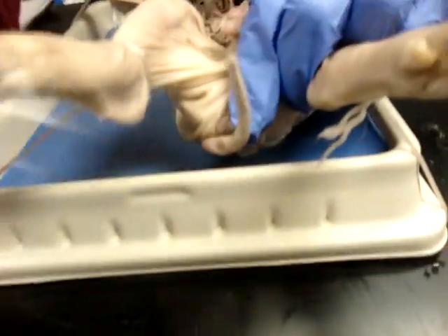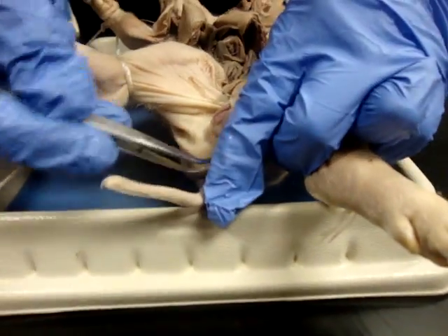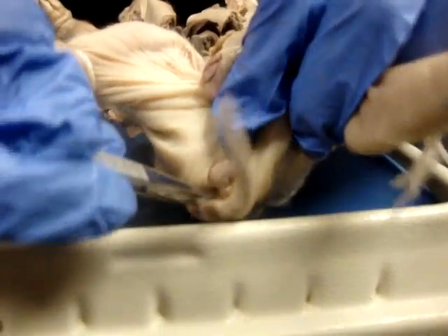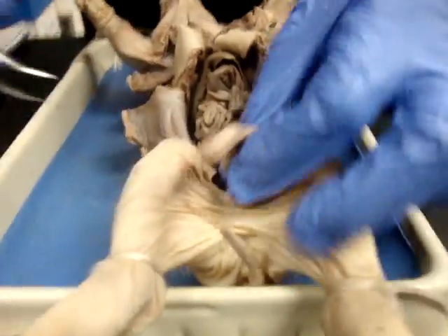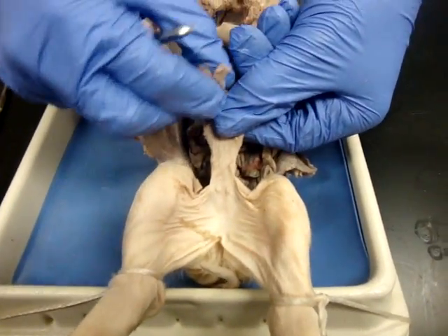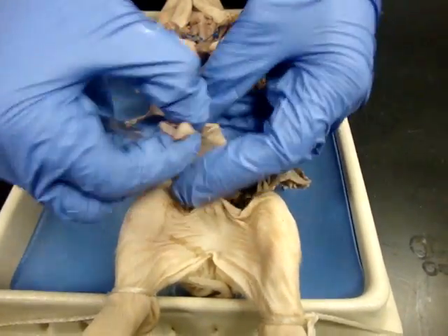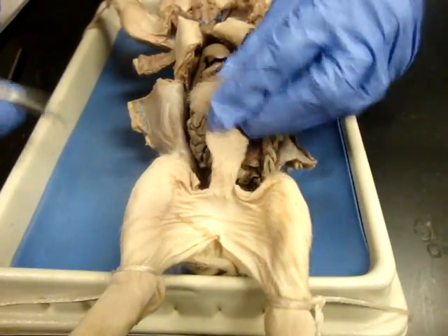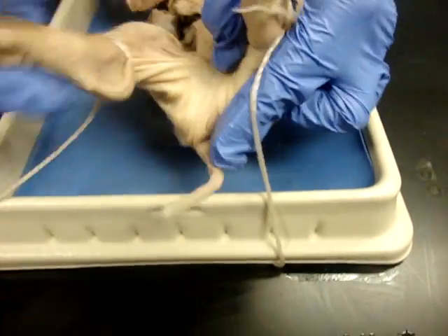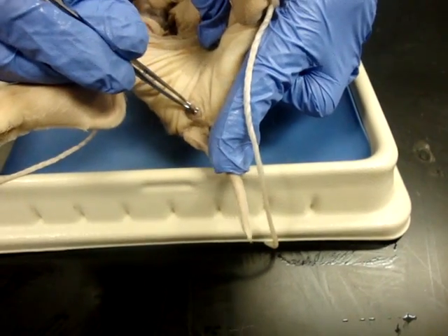So the first thing we'll do is to look for the anus, which is going to be exactly where you'd expect it to be, underneath the tail. The next thing on your list is the umbilical cord. Your umbilical cord, of course, is going to extend where the belly button of the pig would be. The urogenital opening for the female, you're going to find it right back here by the urogenital papilla.